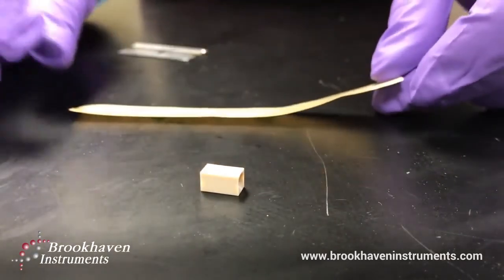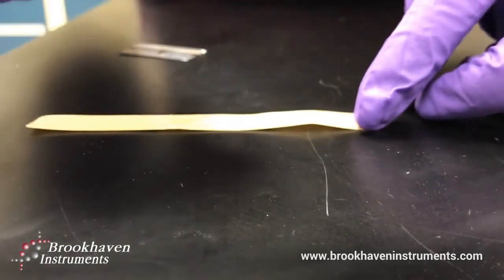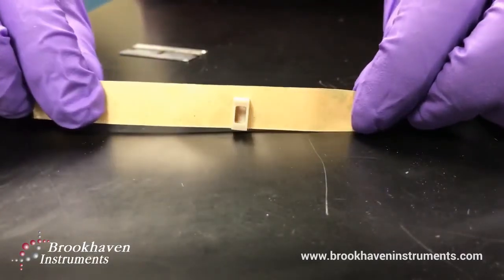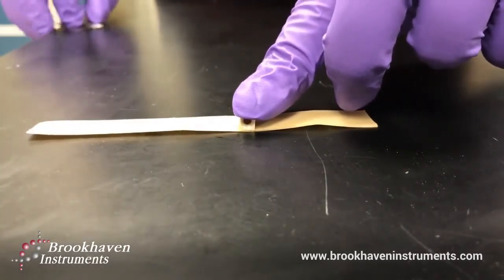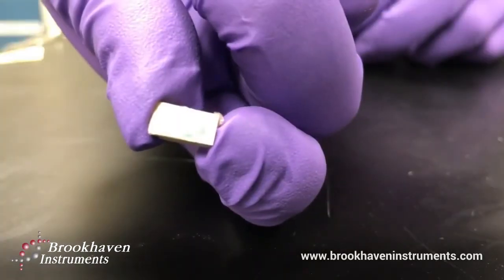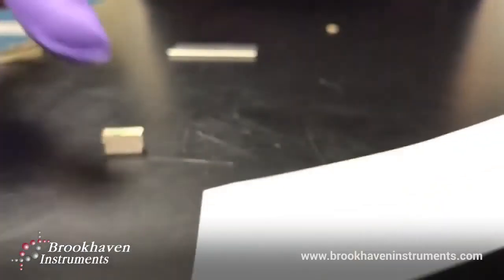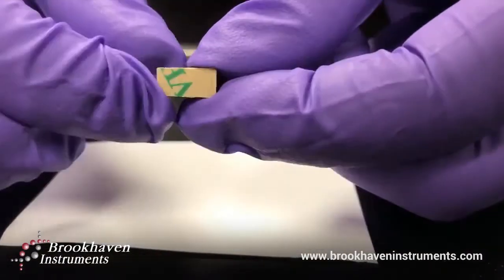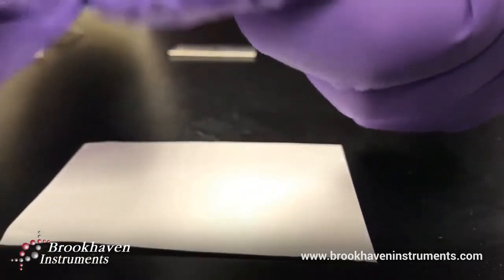Take the adhesive — here I am using a double-sided silicone tape — and attach it to the substrate, minimizing the exposure of the adhesive. Since the other side of the silicone tape is protected by paper, the tape can be cut to size most easily using a razor. Next, have your sample ready. Place it onto your clean surface. Then remove the protective paper from the tape and firmly press down the substrate onto the surface.